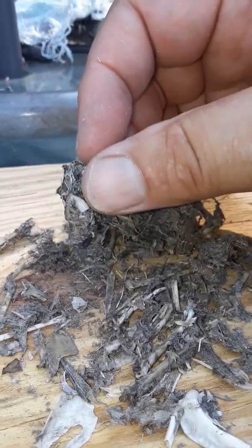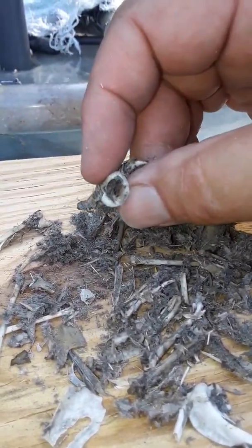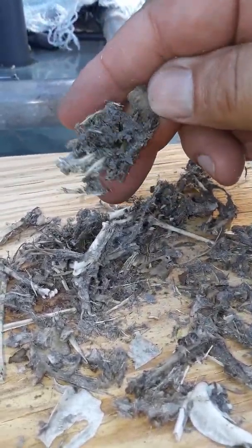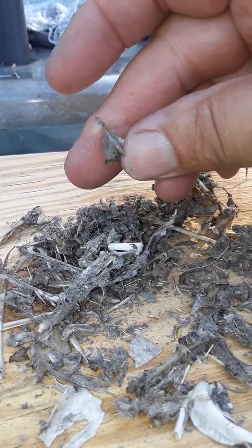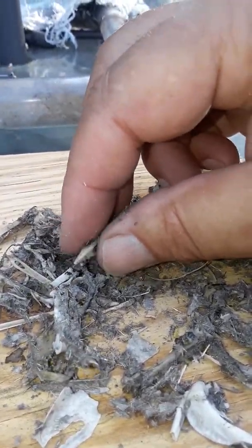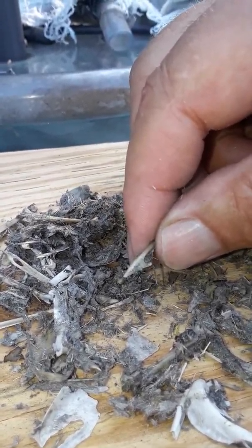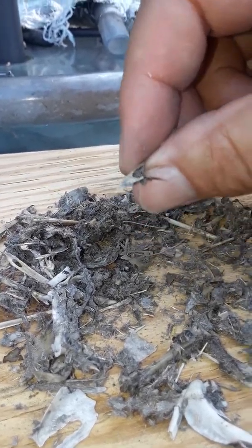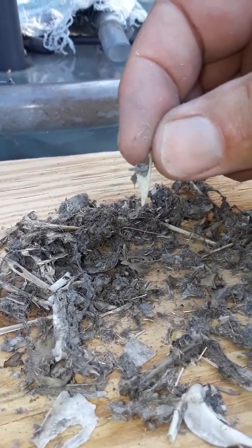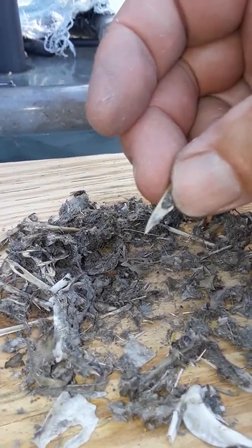See that? That's a skull there. Leg bone — I wish I knew what he was eating. That's the orbitals, the bone that's around the eye. Man, there are no bits of rodent in here at all — this is all bird. There's another part of the keel, the breastbone.